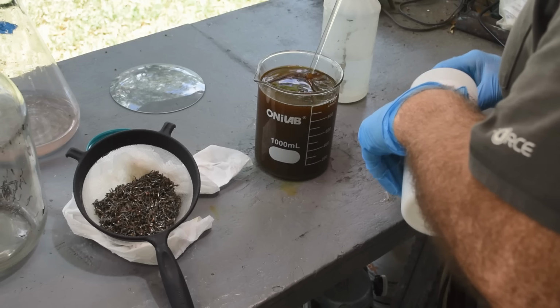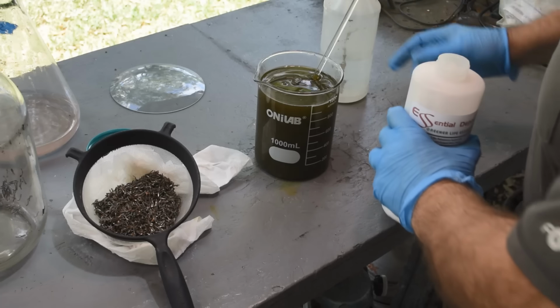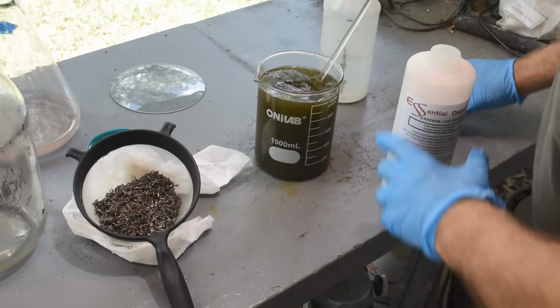So what should happen here is that this should darken. And we should get, oh yeah, the color's changing a little. And we should get a precipitate. Oh yeah, we are getting a precipitate. I think I've got more than enough potassium hydroxide in there. Oh yeah, look at that, it's green. That's interesting. It's green. But yeah, we're definitely getting a precipitate.